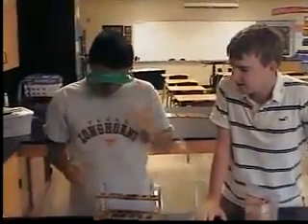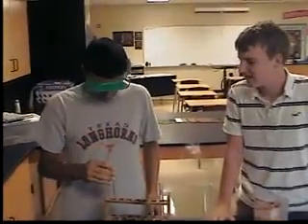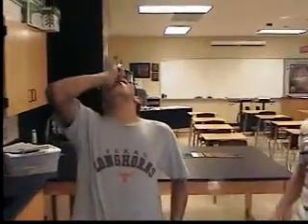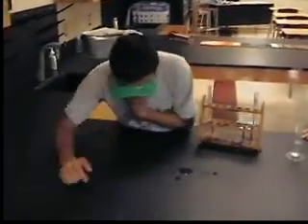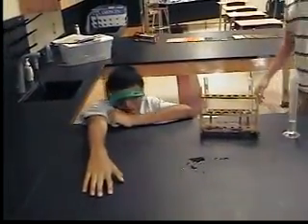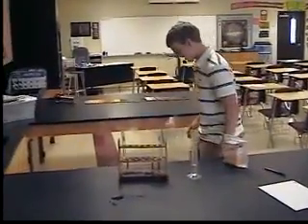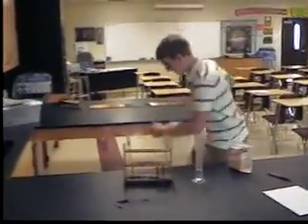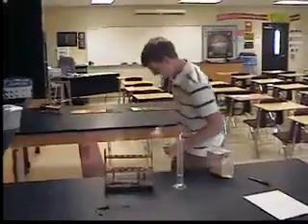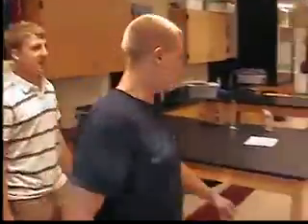Alright. To continue. Don't smell it. That's sulfuric acid. Don't drink it. Oh! Anthony, are you all right? Anthony, get up! Shazam! Anthony drank sulfuric acid. Oh, he did. What an idiot.